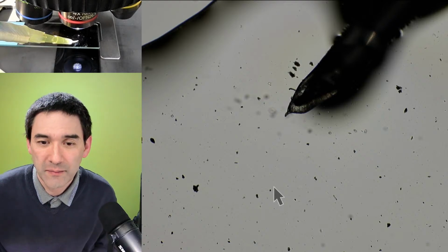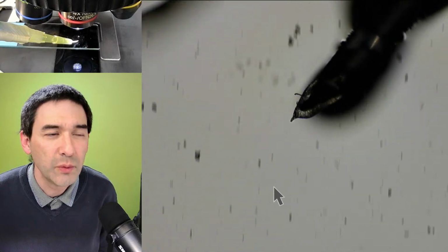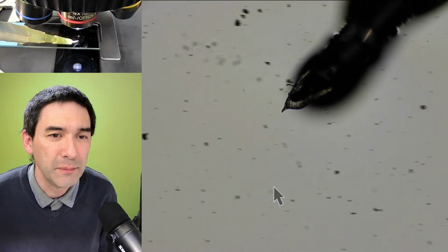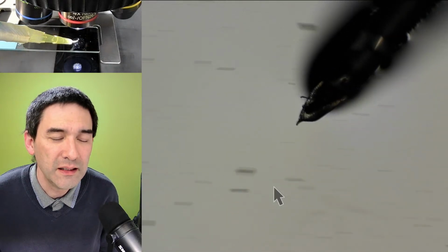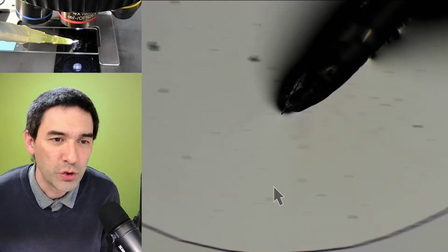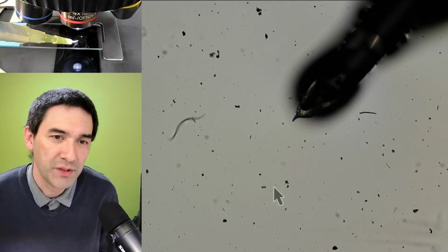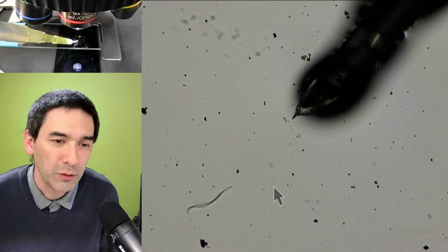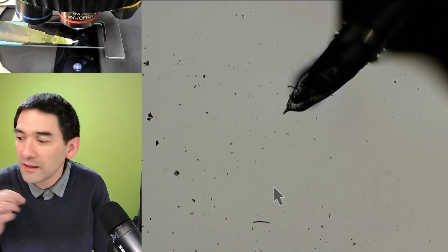So you see that when I move it around, the pipette is a little bit flexible as well, right? This is a little bit the thing that I've been playing around with, and I just wanted to share it with you. But I'm going to show you now how I was able to pick up the nematode here, after all. I'm going to now show you how you can actually make the tip very thin, okay?